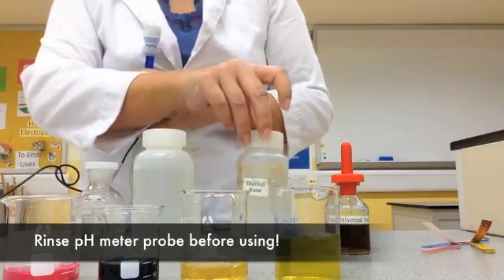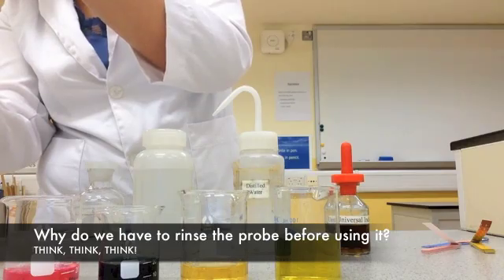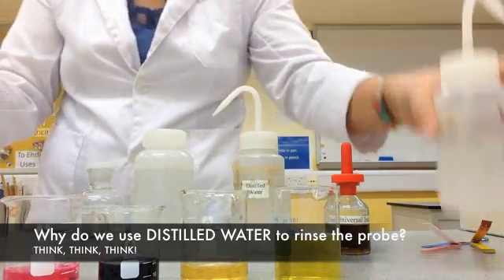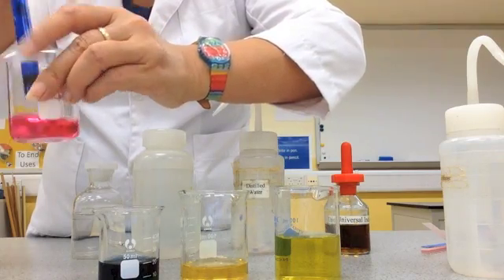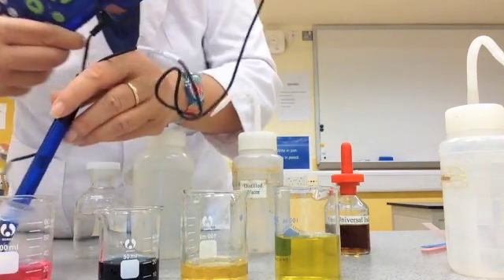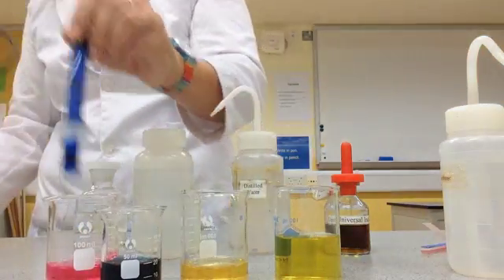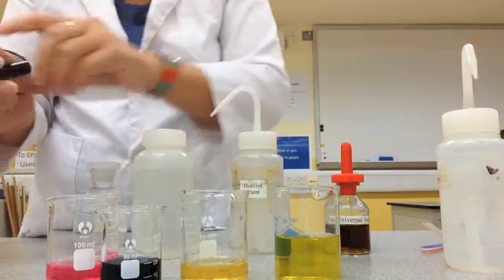Every time we use the pH meter, we need to rinse the tip to make sure it's clean. I use distilled water to clean it — you should be able to figure out why. Let's test the first substance, which appeared pink. I dip it and the pH meter reads 1.7 — so it's not exactly pH 1, but 1.7.